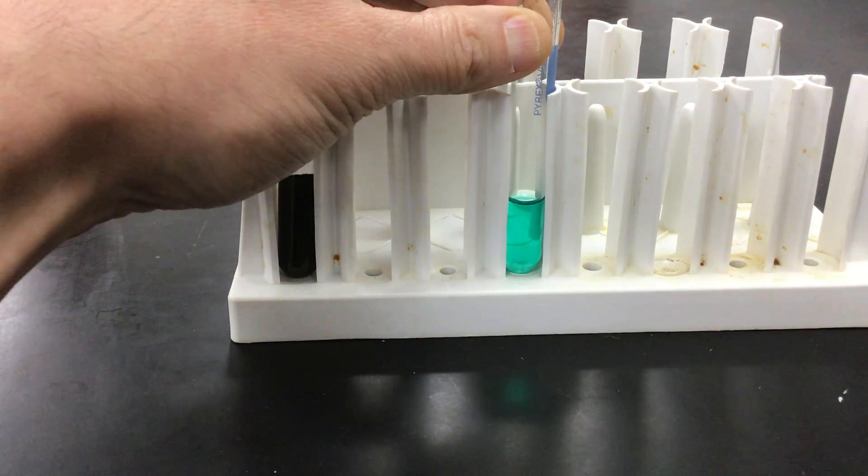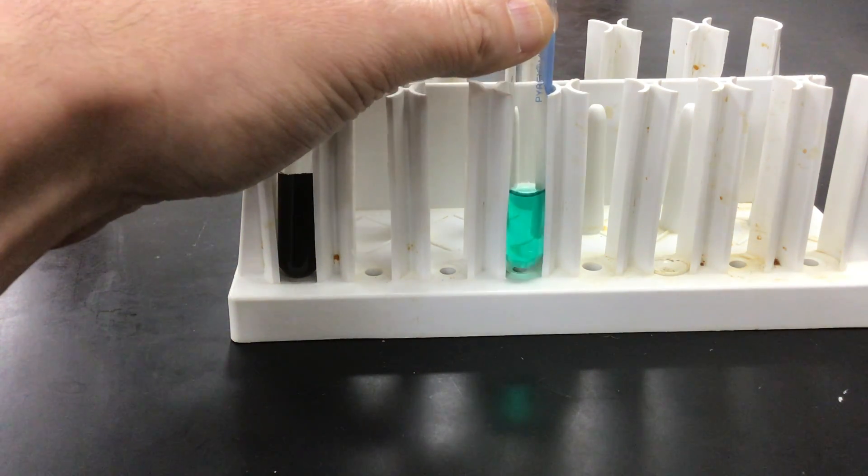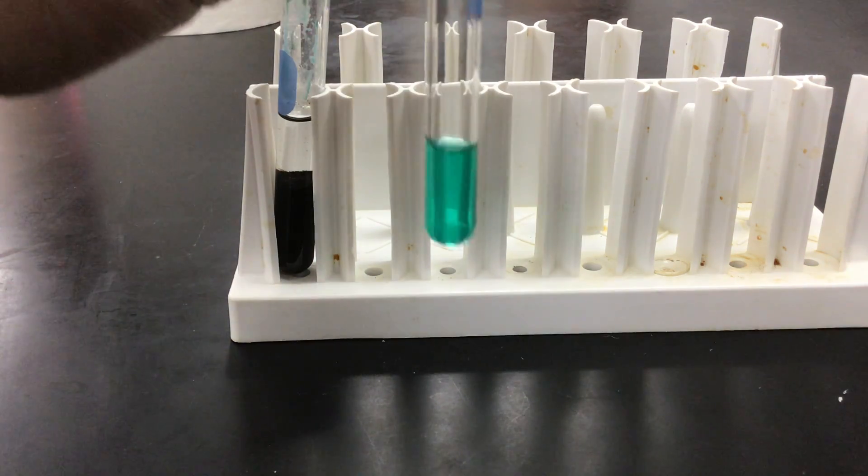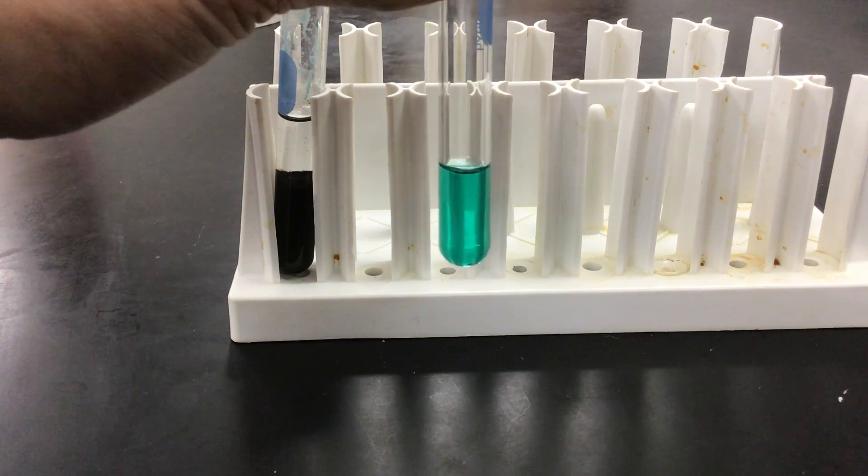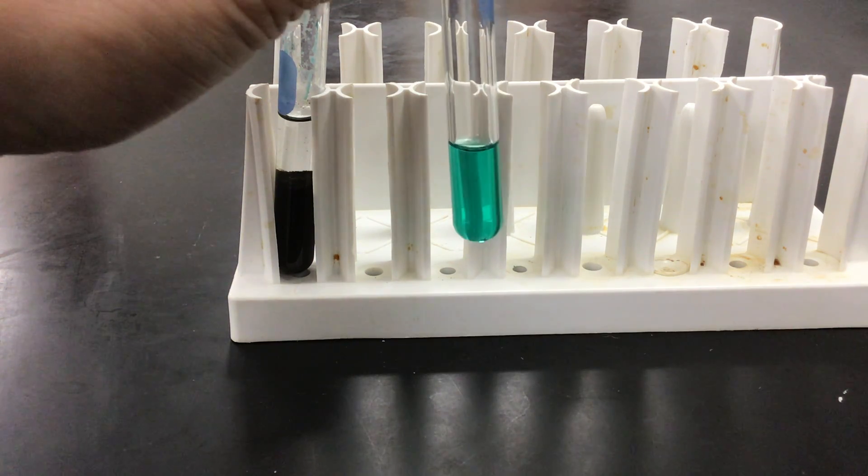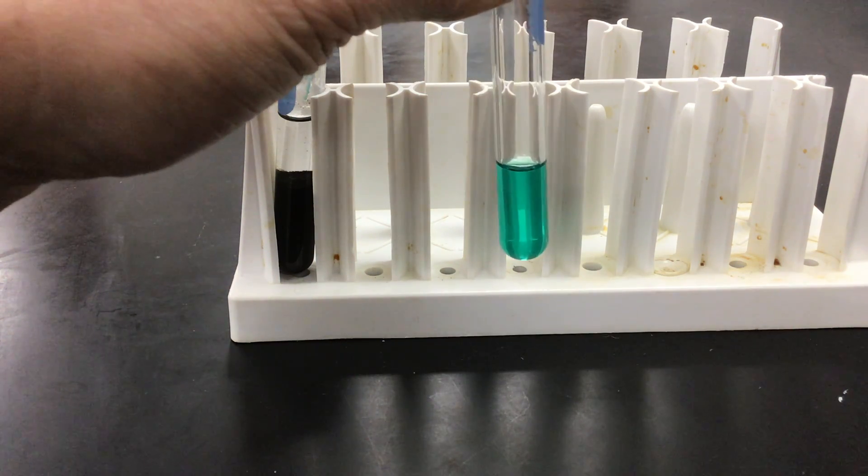And there we can see now the color change that has taken place against the white background. So the black solid has been totally dissolved by the HCl, forming the products.